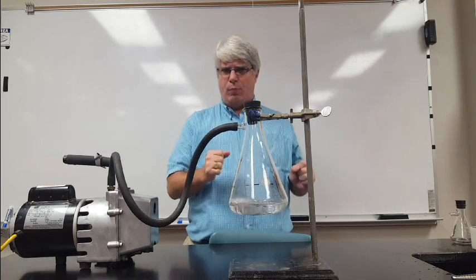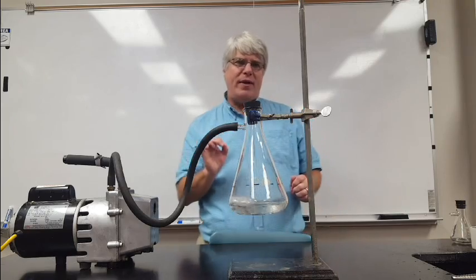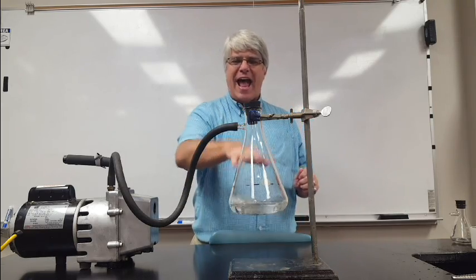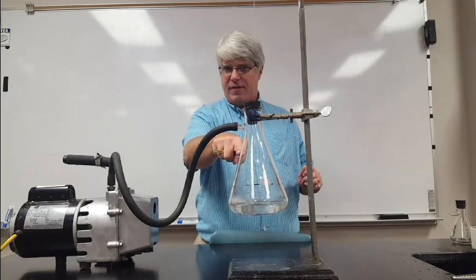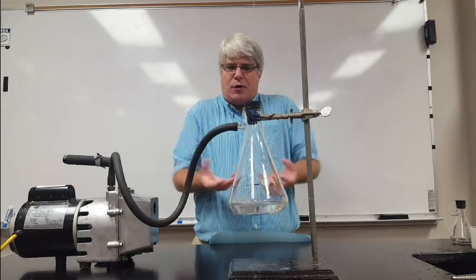I'm not heating this to boil. I am removing pressure because the boiling point is defined as the point at which the external pressure, which is the pressure in the flask, is the same as the pressure the vapor is exerting by evaporating.